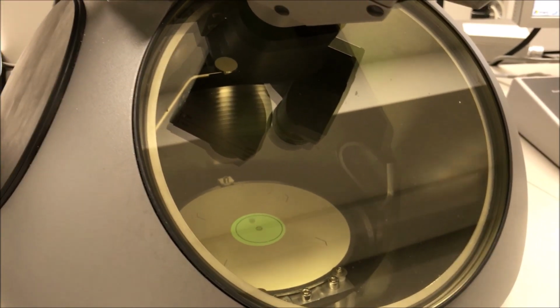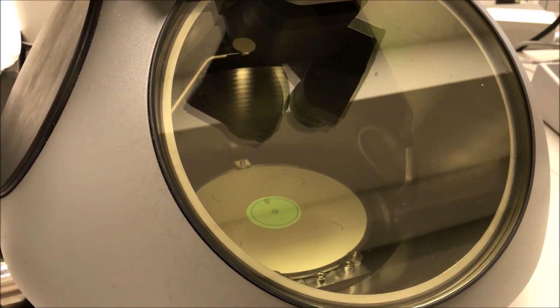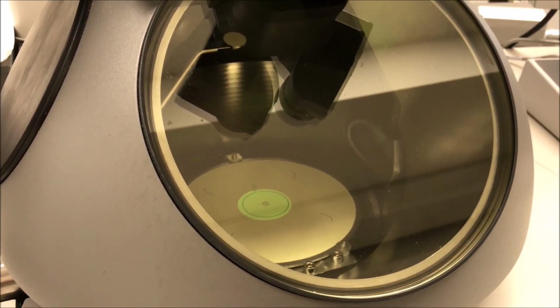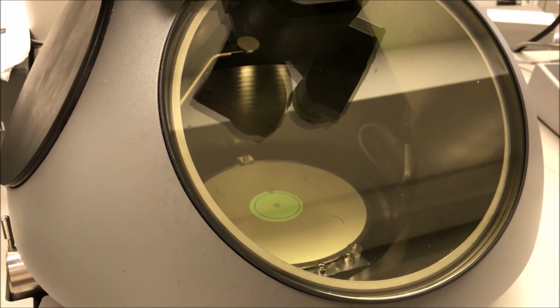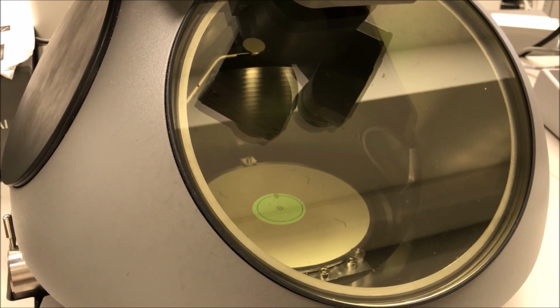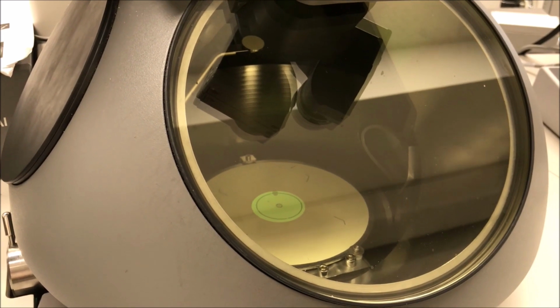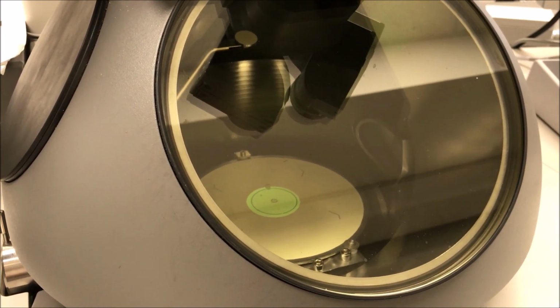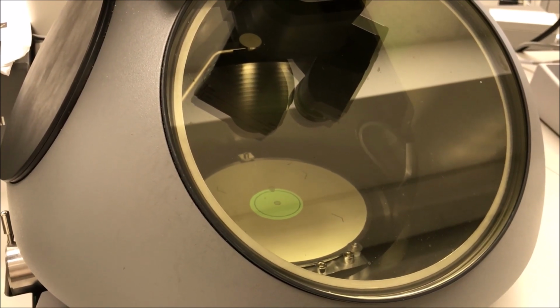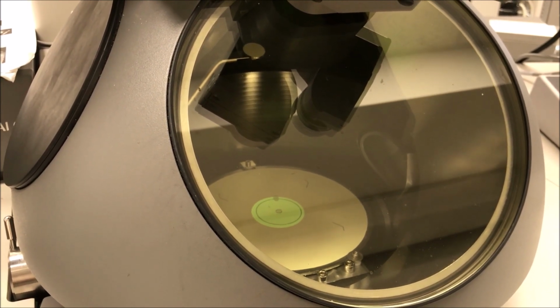And so how long do you need to do this? Generally speaking, 10 to 20 minutes should be enough. I'm going to let this run for 20 minutes. Of course, you want to do this over the area that you're going to analyze. Then once that's done, we'll pick the video back up and I will go back into STEM mode, and we should now not have the same contamination problems that we were having before.